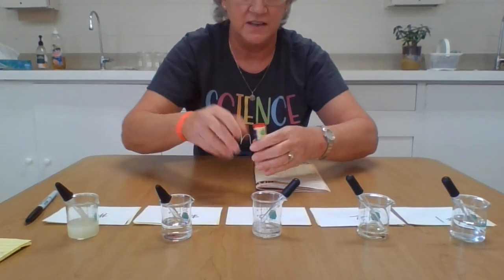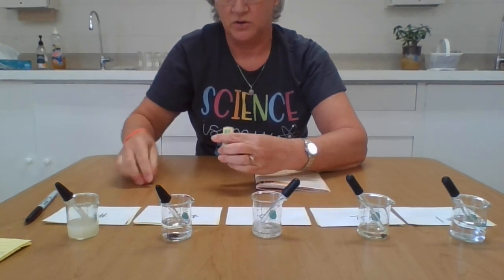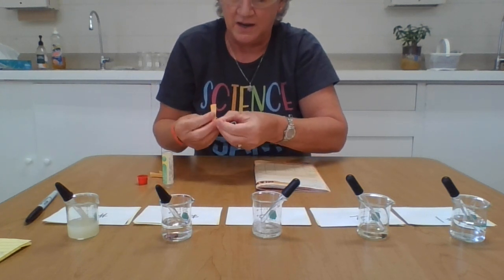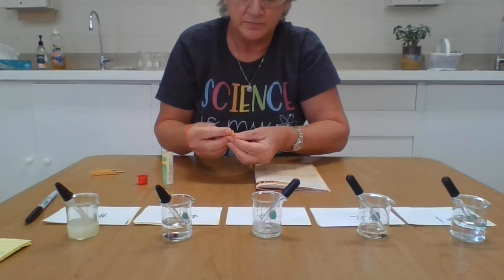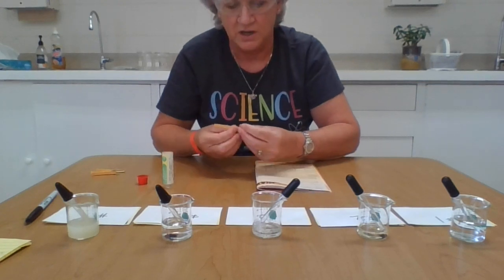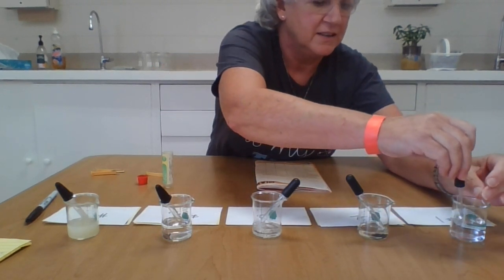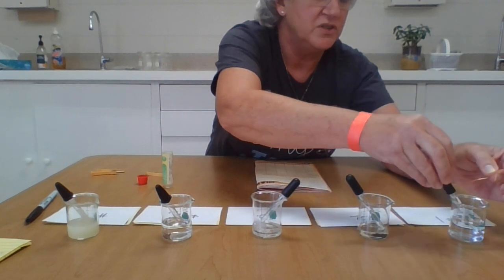So what we're going to do is test each of these substances, and I'm going to tell you what color the litmus paper turns. This is something you can buy at any science supply store, possibly even drugstores like Walgreens, if you're curious about testing things to see if they're acids or bases on your own. What I'm going to do is very quickly put a couple drops on each paper, let it sit for a minute, and then I will report to you what color they turn.